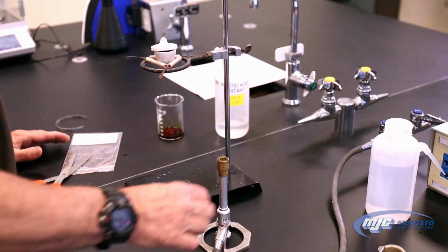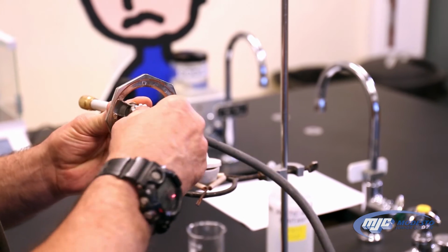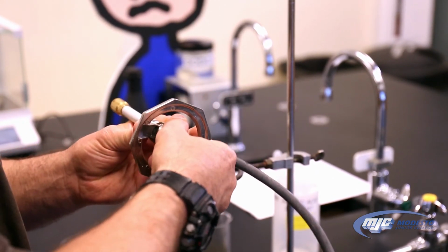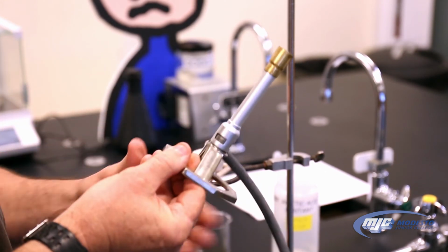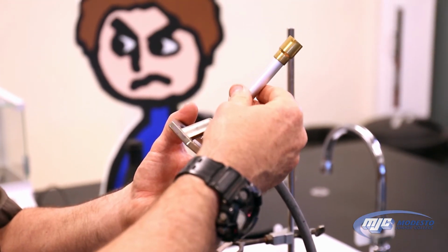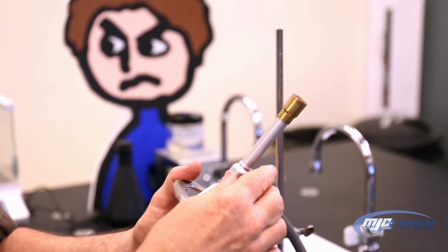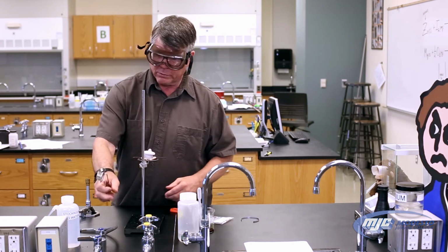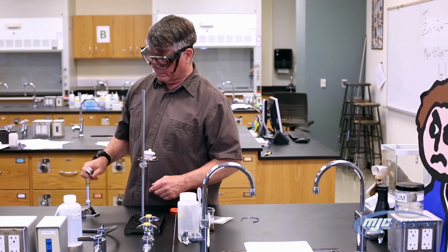So to light the flame, first thing we're going to do is make sure that this needle valve is set properly to start. So close it all the way, back it out about 1 turn, about 360 degrees. Adjust the gap here to where it's about 1 millimeter between the top of this outside gap and the top of the threads. Now we're ready to light it, and we'll adjust the flame once it's lit. So turn on the gas. Remember, when this handle is parallel to the nozzle, it's on.